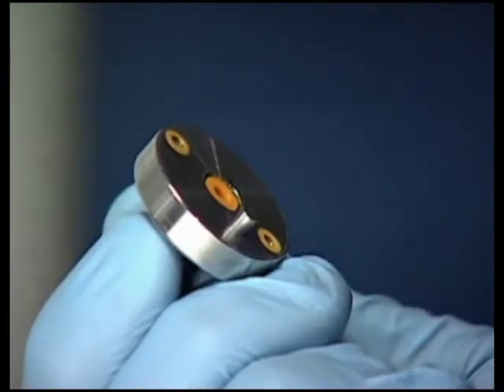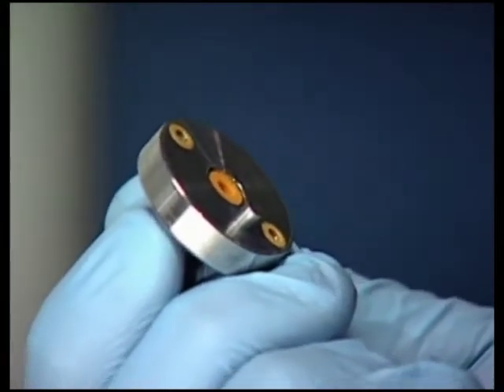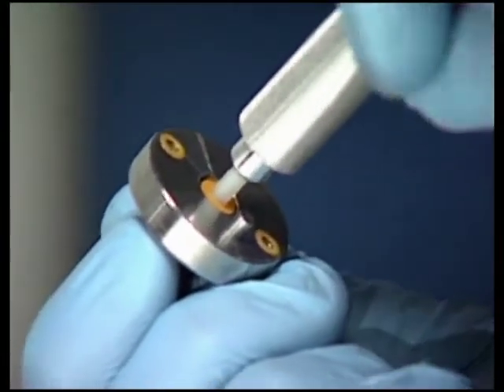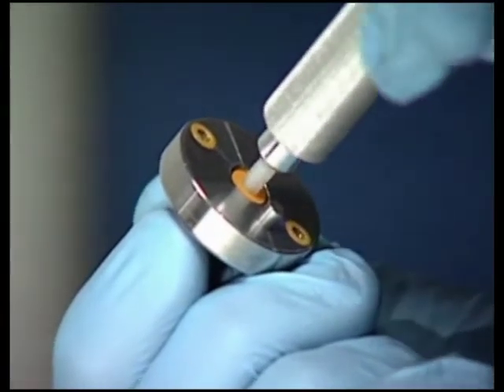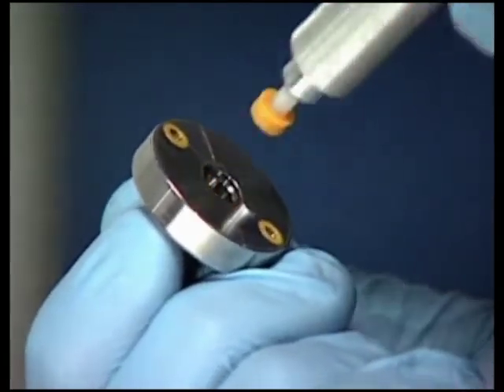Be careful not to scratch the surface of the head when removing the seals. Use the nylon-tipped end of the seal removal tool to extract the plunger seal from the head.